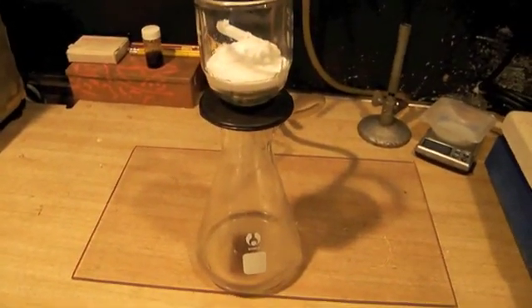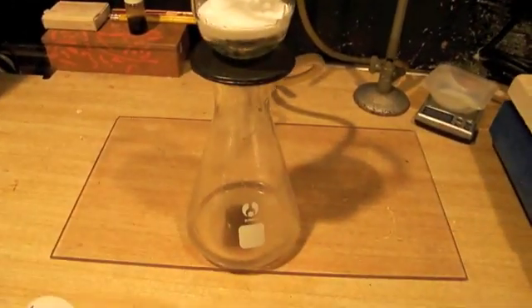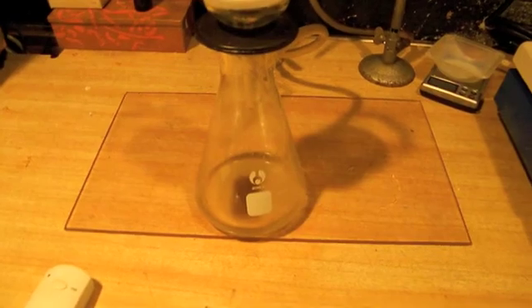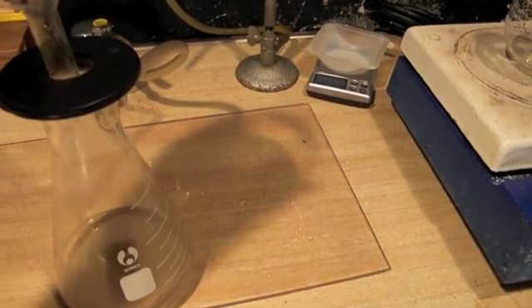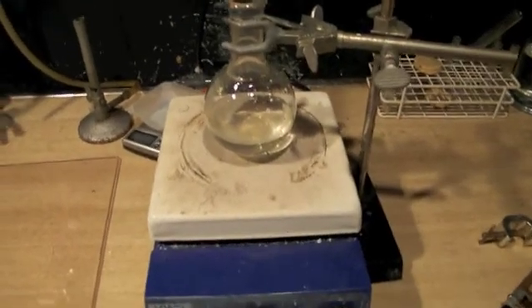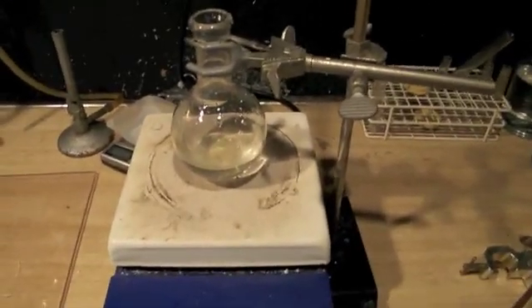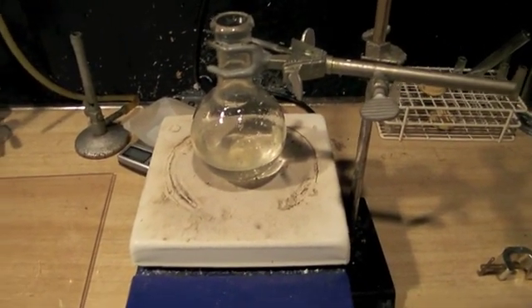You didn't get to see it here, but I set up for vacuum filtration using a Buchner funnel, a filter adapter, and a fritted glass filter. In the filter is a potassium chloride precipitate. There is some dissolved potassium chloride in the hydrobromic acid that's in the flask, but that will not affect the next part of our procedure. This filtration could have been performed using a glass funnel and a filter paper, or you could simply have decanted off the liquid from the precipitate. The precipitate will not affect the procedure.